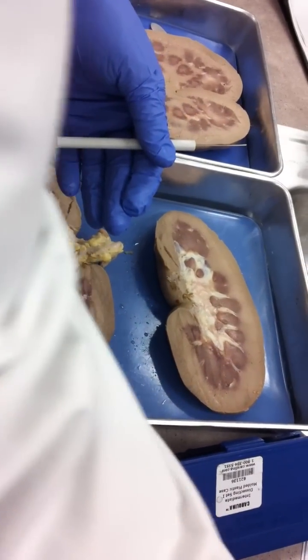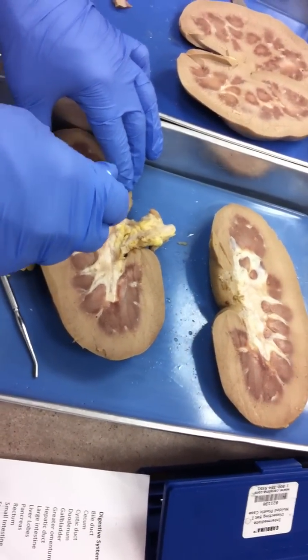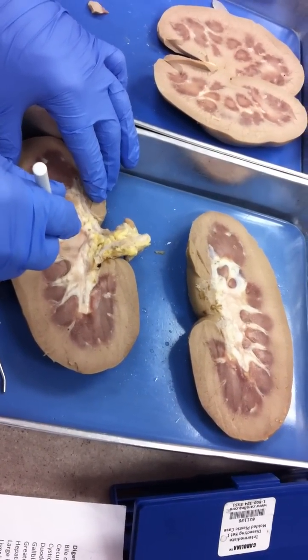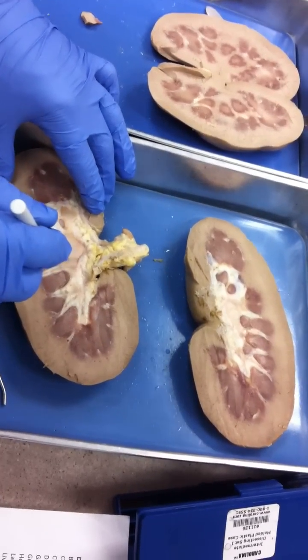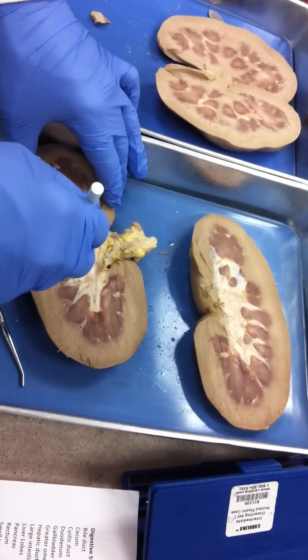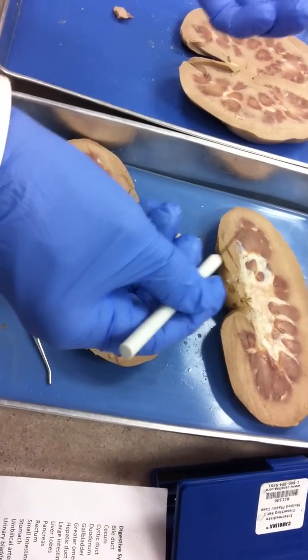Next to the renal pyramid is a structure called the renal papilla. I'm going to have a pin right in the middle of one of these pyramids — you'll label it renal pyramid. I'll have a pin right next to it — that'll be the renal papilla. Those two go together like eggs and bacon. The papilla is more medial, more interior. Remember: both start with the letter P — pyramid and papilla.